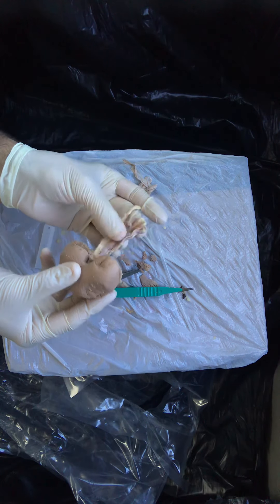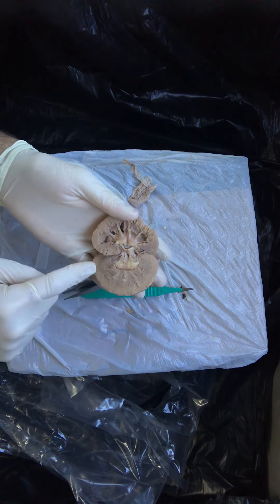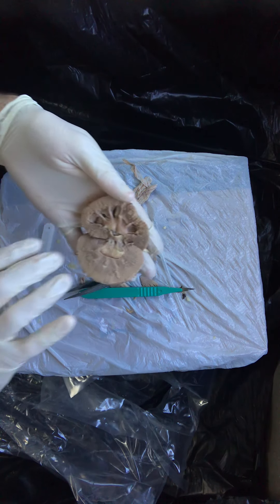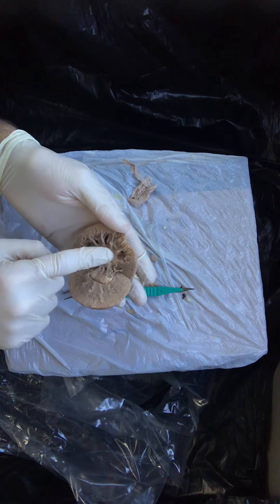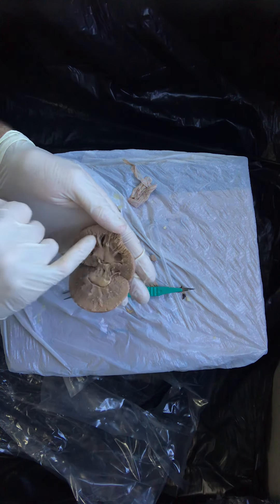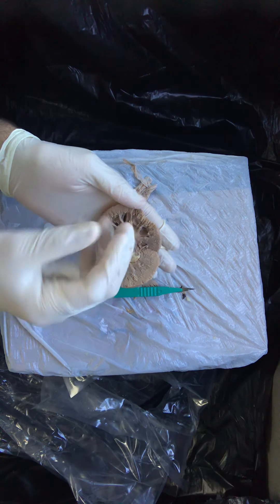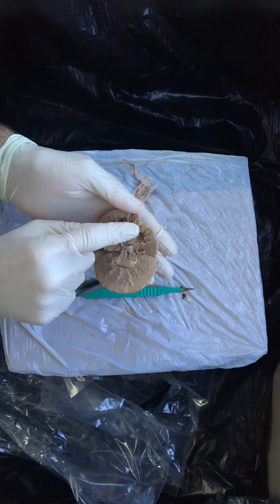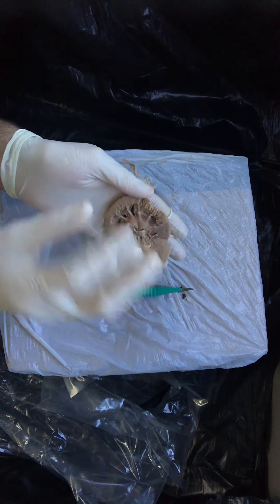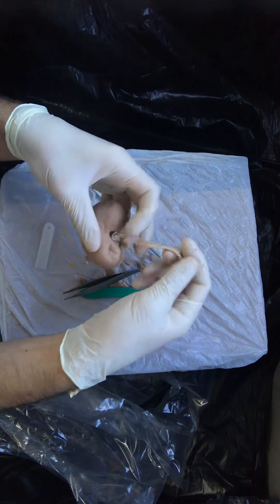So, to recap: hilum, hilar structures like ureter, renal artery, and renal vein on the medial surface of the kidney. Opening it up, we can see an outer, slightly lighter color cortex, and inner medulla, which has been partitioned off into pyramids as the cortex separates it by renal columns. There's a central collecting system, which is formed as these little minor calyces surround the tips of the pyramids — the tips of the renal medulla called the renal papilla. These minor calyces surround them and collect the urine that's produced there, just like a gutter collects rainwater. Those small minor calyces join together with neighboring minor calyces to form larger major calyces, which unite to form this single central large funnel called the renal pelvis that ultimately narrows down into a tube carrying the urine away. That tube is the ureter.